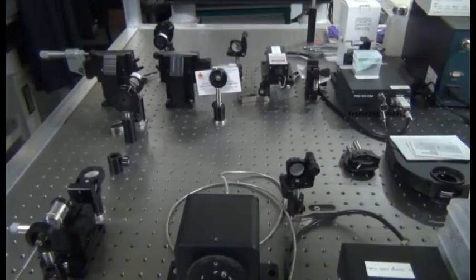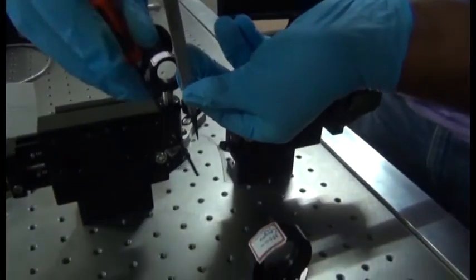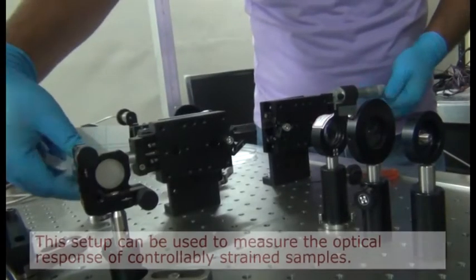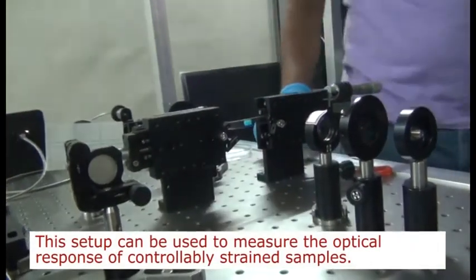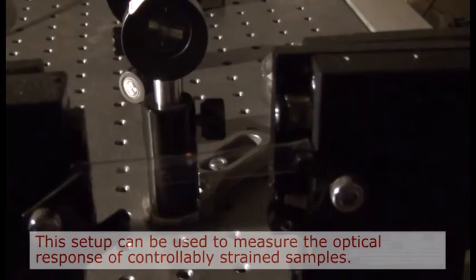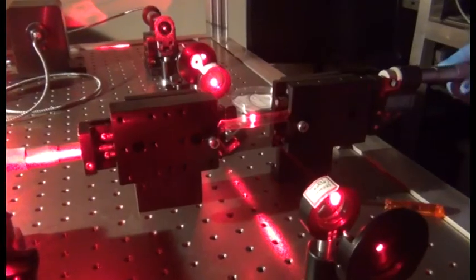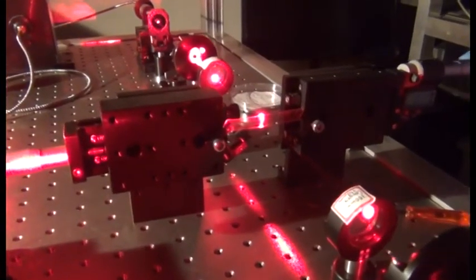In this setup, we use a set of converging lenses for illuminating the sample and collecting the transmitted light, which is then analyzed using a spectrometer. We can measure the transmission spectra for different values of strain applied to the sample and understand the correlation between mechanical deformation and optical response.